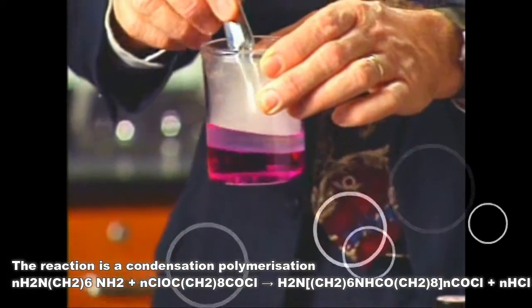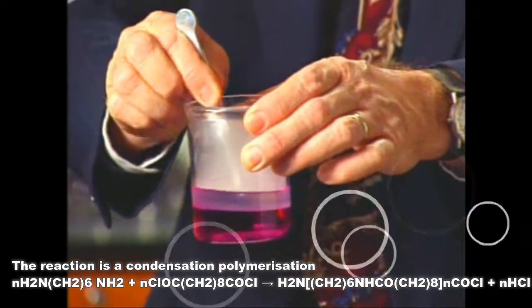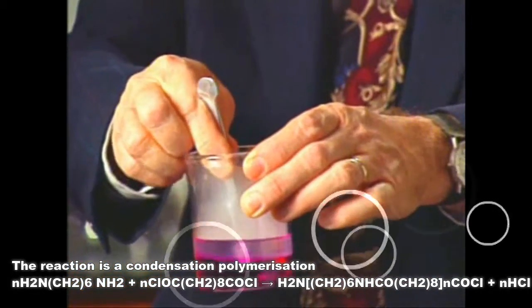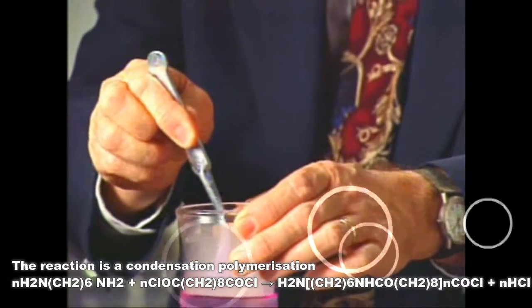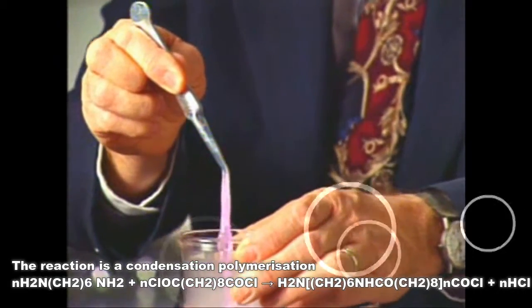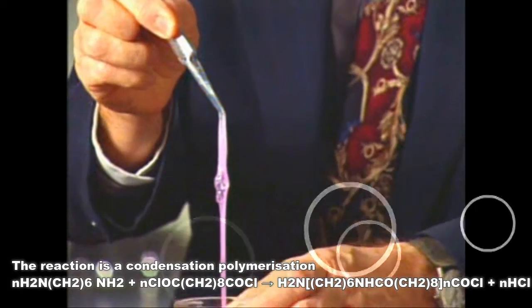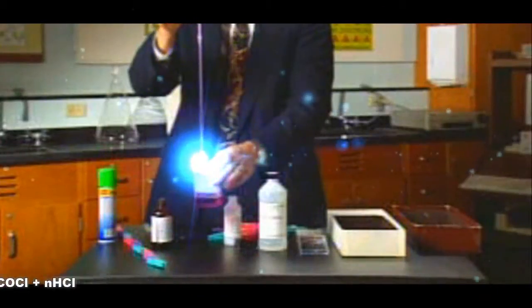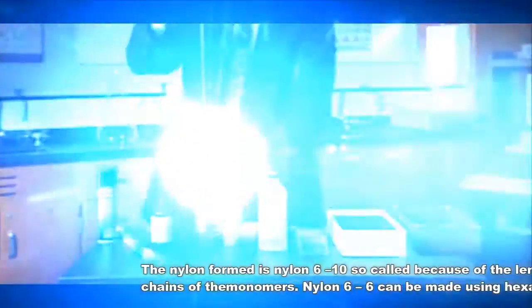If we reach into the interface of those two layers where the molecules come together and react, we can pull out a synthetic fiber.